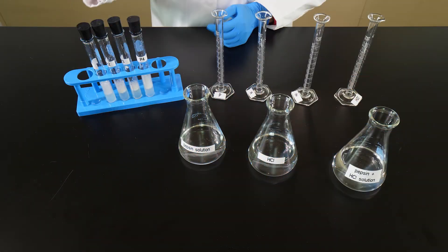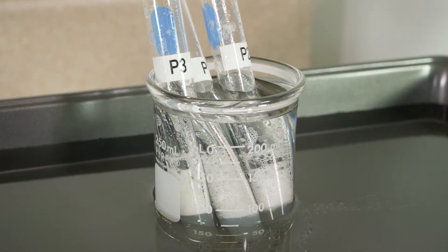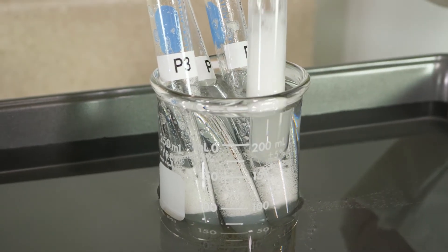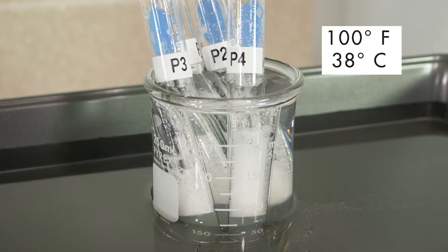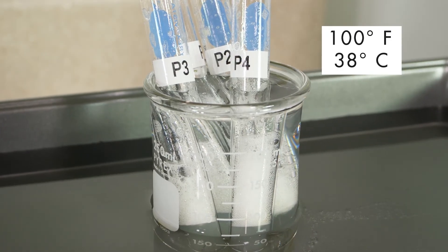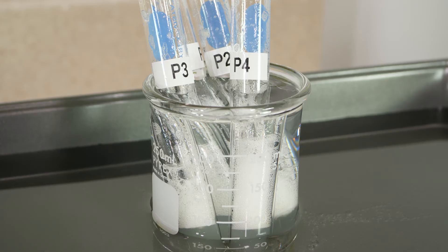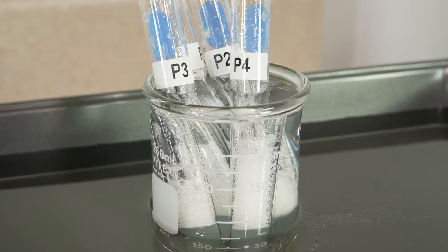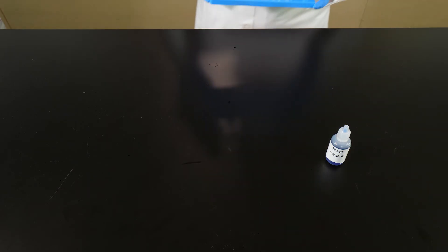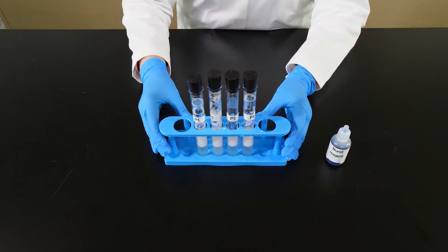Next, all four test tubes are placed in a water bath. The water bath is set at a temperature of 100 degrees Fahrenheit, or 38 degrees Celsius. The test tubes need to remain in the water bath for 45 minutes. It is time to remove the test tubes from the water bath and place them back in the test tube rack.